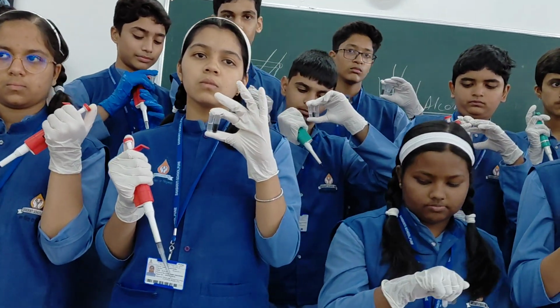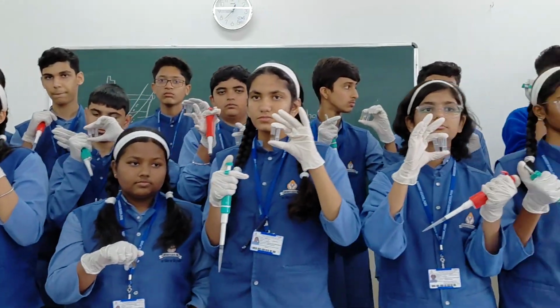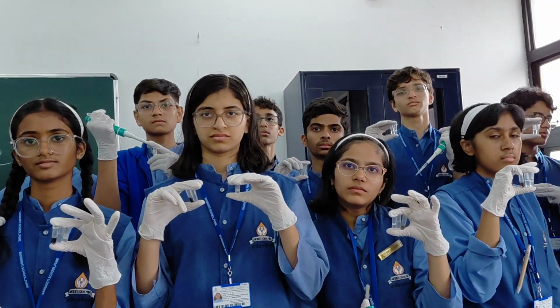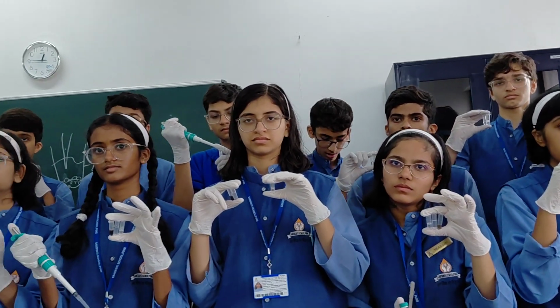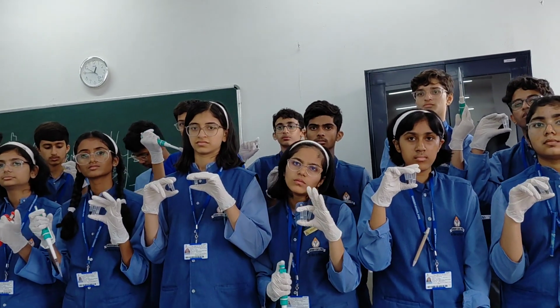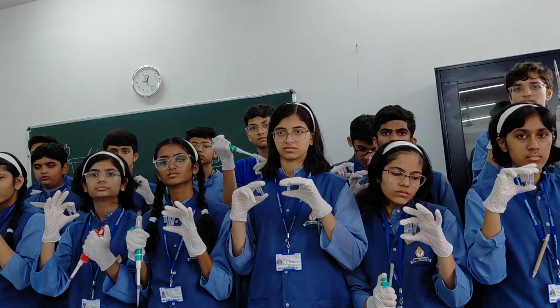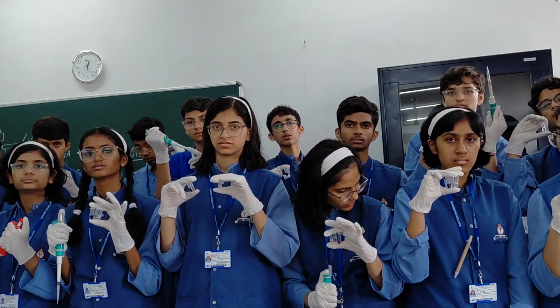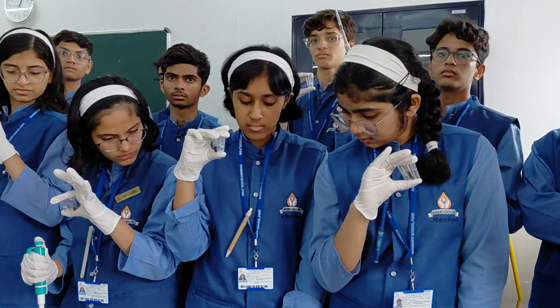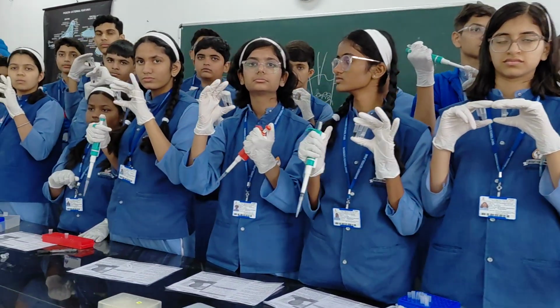The first 2 steps, sample selection and sample homogenization, are theoretical steps. Once you know, you can do it with anyone. The chemical utilized at the cell lysis level, the first chemical, is DNA isolation buffer solution. There are basically 4 chemicals. First one is Tris, second one is EDTA, third is NaCl, fourth is either CTAB or SDS. CTAB is used for fungal and plant DNA, SDS is utilized for all kinds of animal DNA isolation.